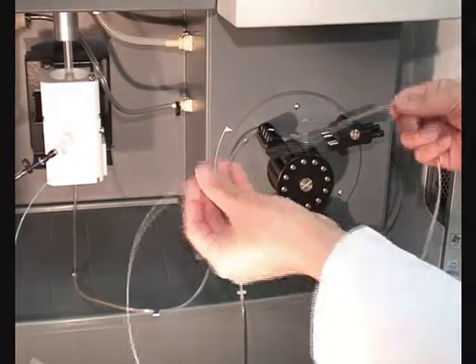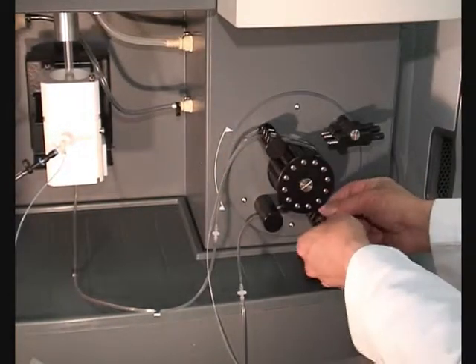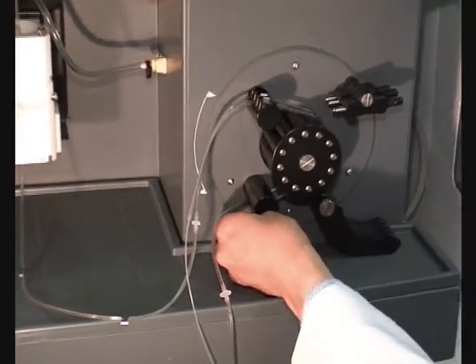Select the sample pump tubing and stretch the tubing clockwise over the pump rollers, securing the tabs in the top and bottom grooves.